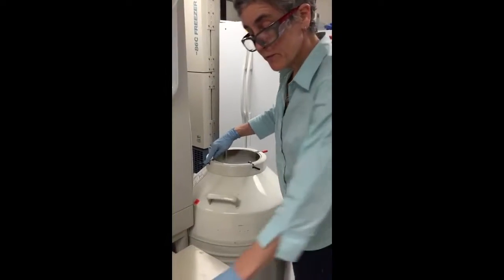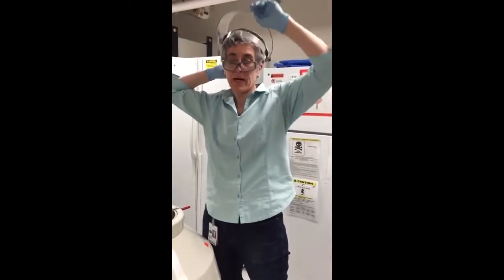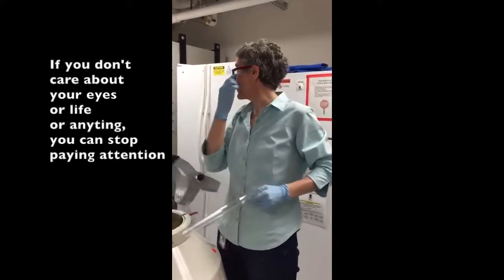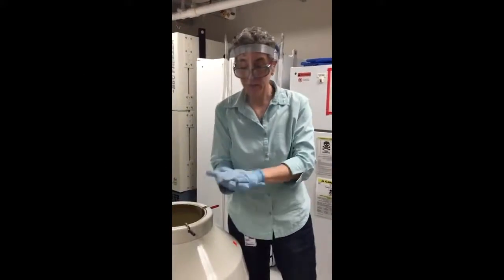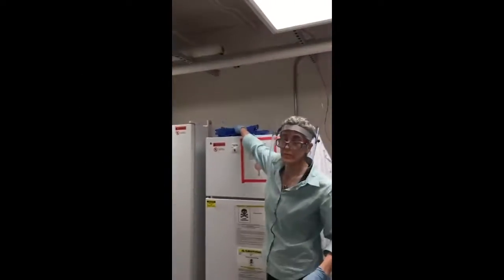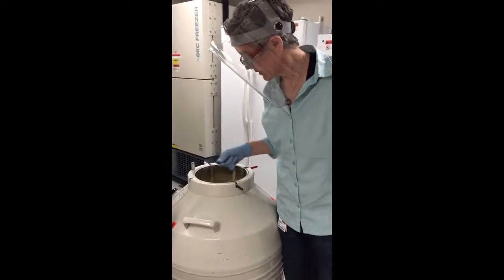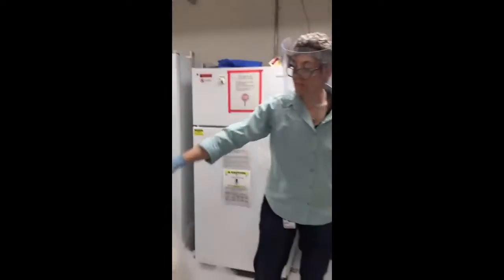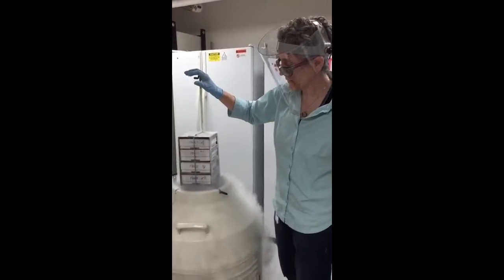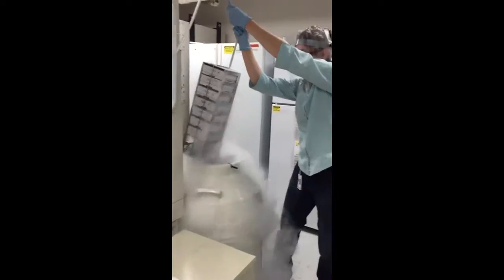Here are four colors — it was blue, four. All right, before I go on: safety. I'm using liquid nitrogen. I don't want to splash it into my eyes. I've got to have my safety glasses on with the side shields and my face shield on as well. You can also wear blue gloves. Blue gloves are right here.